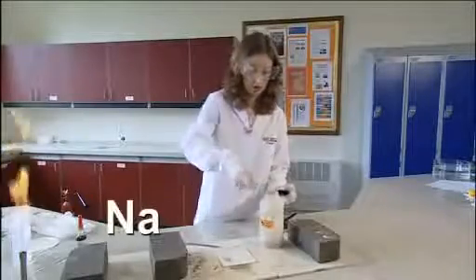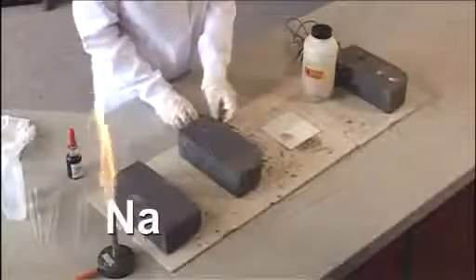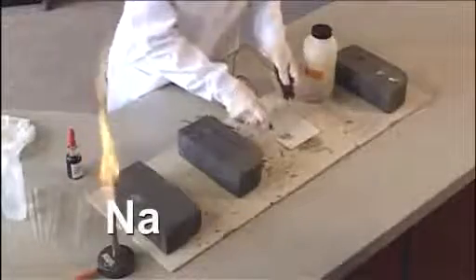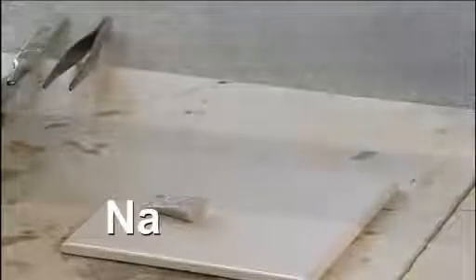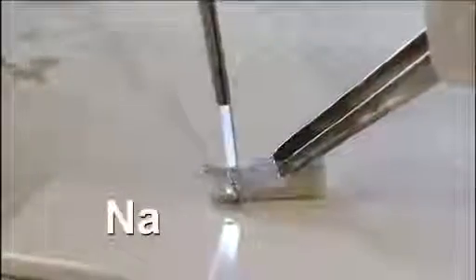Put that large chunk back in the oil. We can use a circuit tester to show that it conducts electricity. And cut off a small piece ready to heat in air.